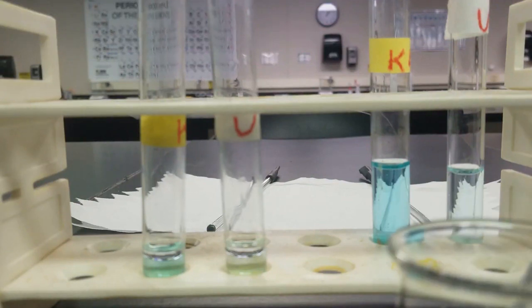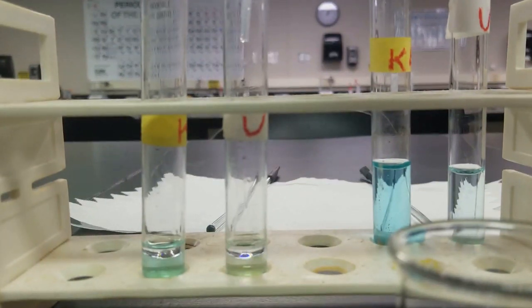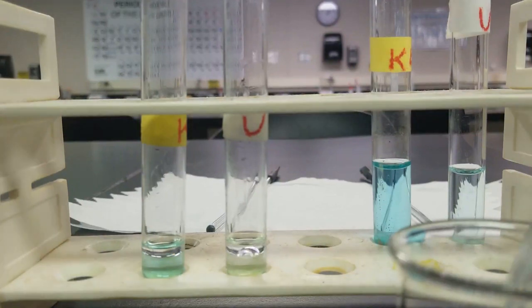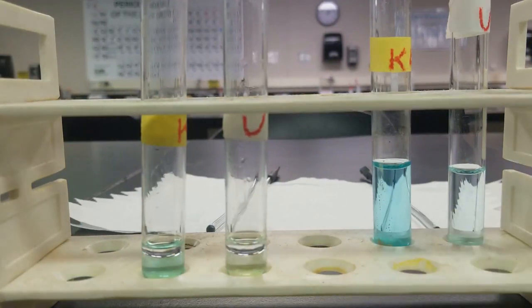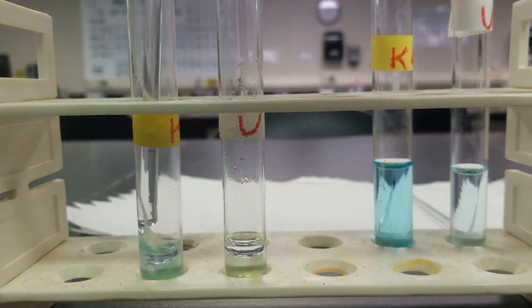A little bit more of the iron as well, just in case something's going on. Remember, we have our known, so that should always test positive. So if something's not testing positive, it means we've got a little issue to troubleshoot. Let's check it out. What happens when we agitate this solution?